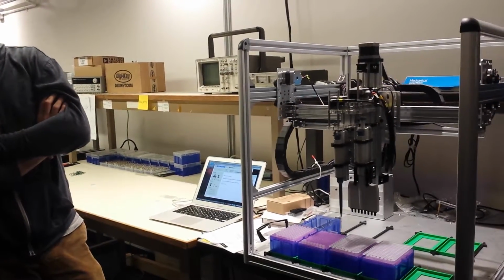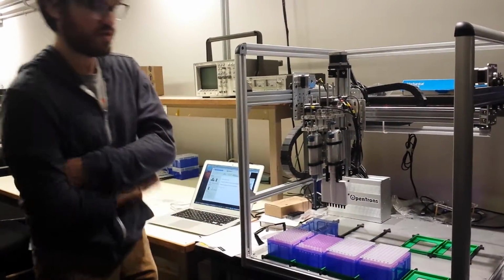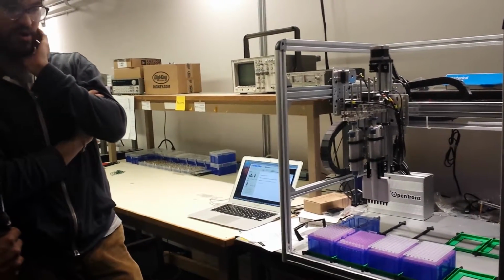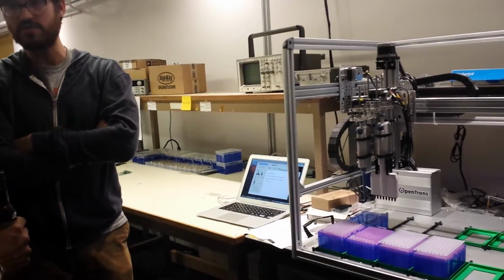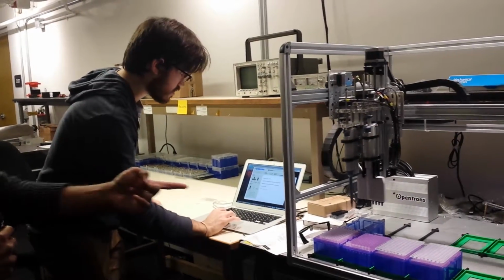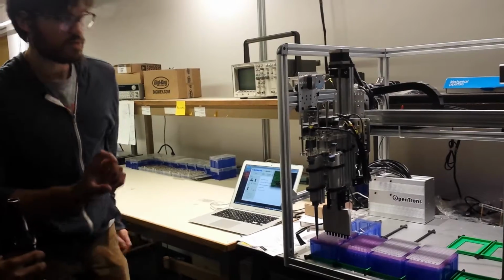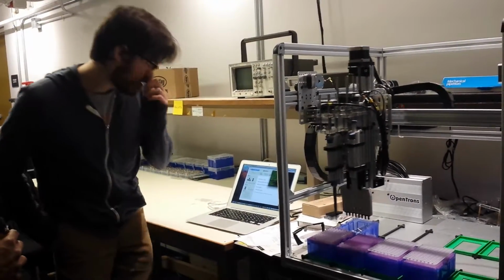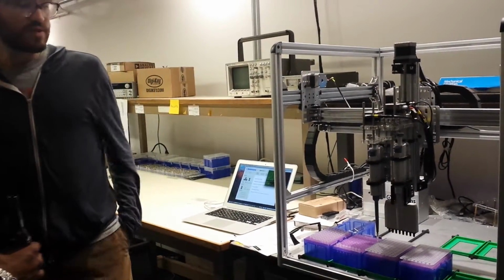Wow. So what it's doing is it's taking combinations of DNA from these wells over here and putting them over here. But the positions in which it's placing them are prescribed by the instructions in a way that's unique for the message that you encoded. So for that, it was 352 bits, right? It only took one sort of pipette slot? Is that the idea? Or you could store more than that in one slot? No, so the whole process is going to take 59 DNA molecule transfers. 59 motions like that? Yeah. Okay.